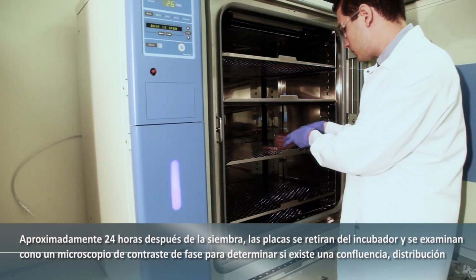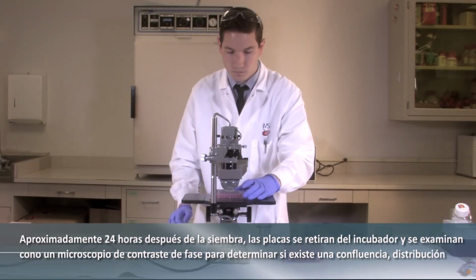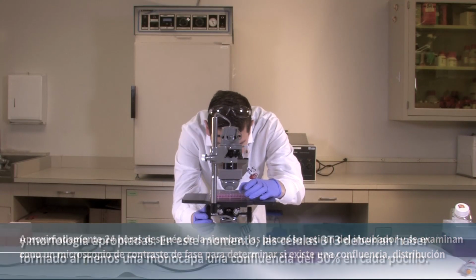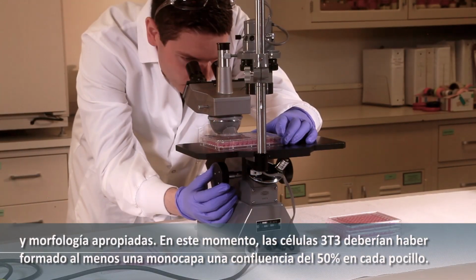Approximately 24 hours after seeding, the plates are removed from the incubator and examined under a phase contrast microscope for proper confluency, distribution, and morphology. By this time, the 3T3 cells should have formed at least a half-confluent monolayer in each well.